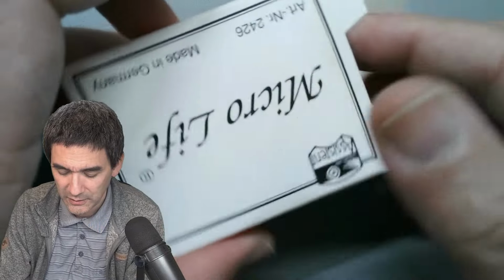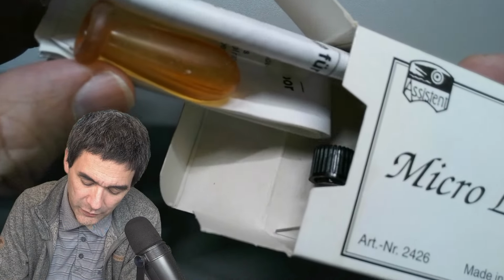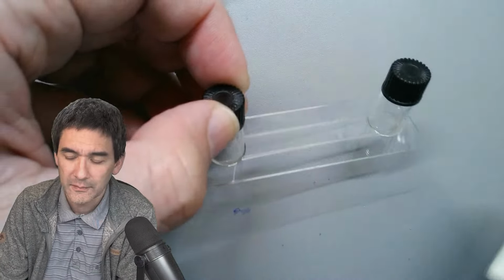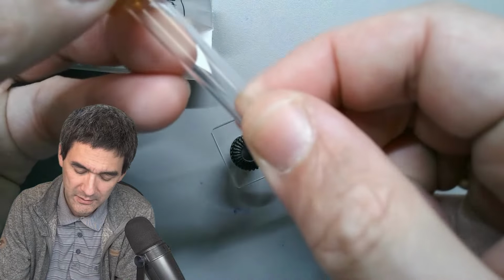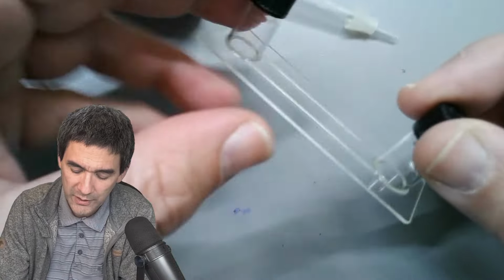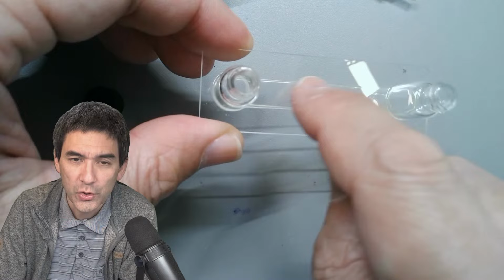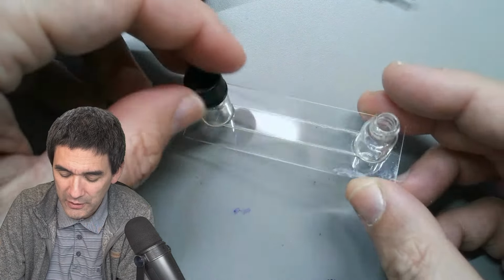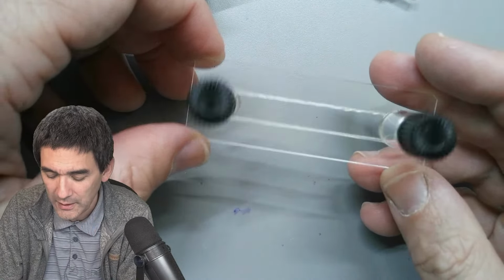This here, they call it Microlife. Okay. I've already used this I think last year or so. Some of you might have already seen this. It's really delicate. You have to be really careful here. Look at this slide. This is how the box looks on the inside. There is a pipette with a little bit of tubing over here to make it airtight, and an instruction manual. You can put a water sample in here, and the water sample is connected over here, so you can observe microorganisms swimming around back and forth. There is enough water in here, and it doesn't evaporate, obviously, because you can put a cap on here. So it would be the ideal solution for such a live stream without commentary.